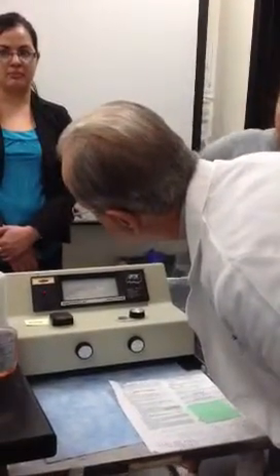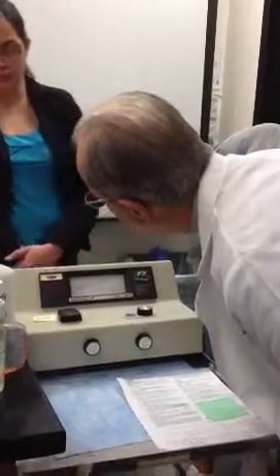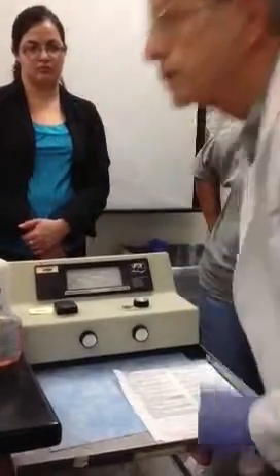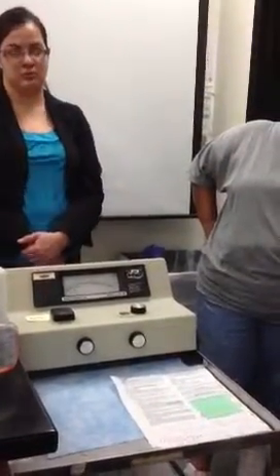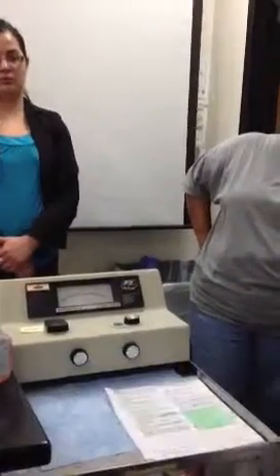And this is reading 0.98 optical density or absorbance and 10% transmission of light. All right. So what was our first number? 0.48. This is now 0.98.